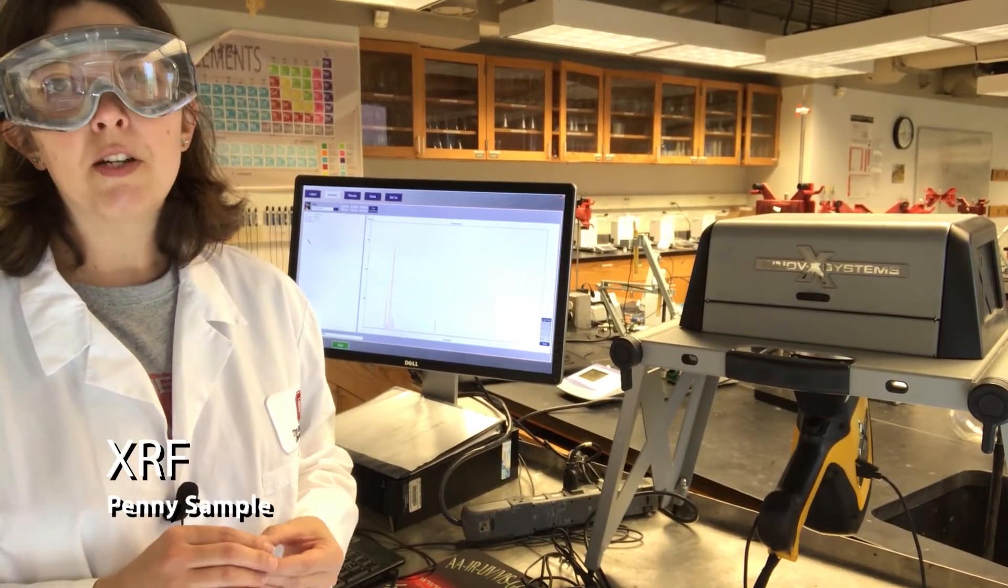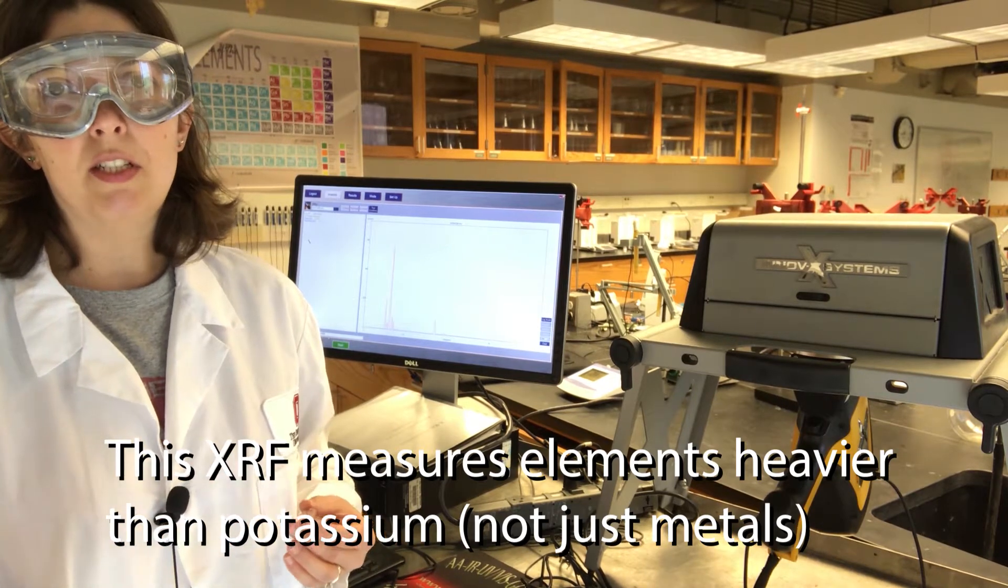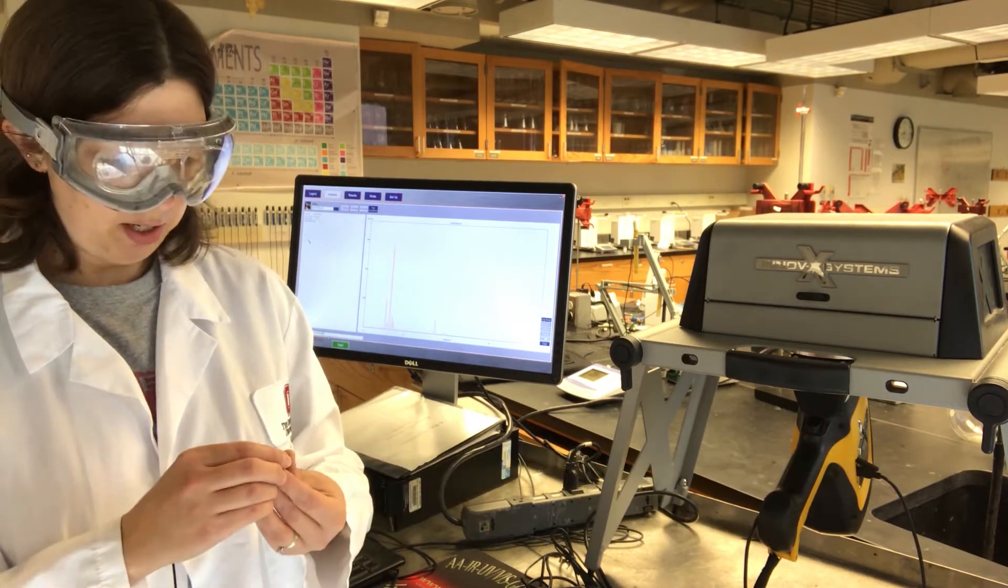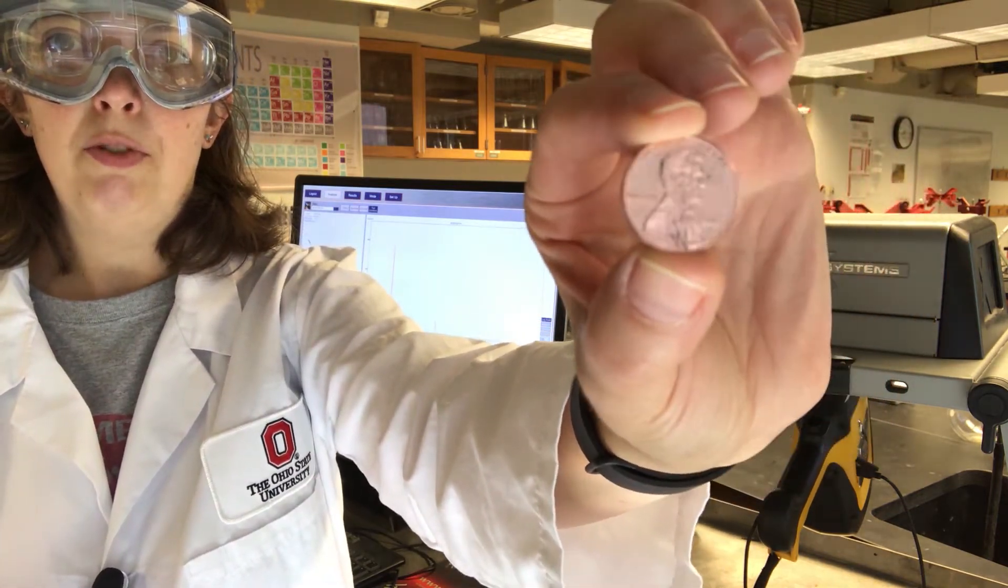X-ray fluorescence measures the metals that are present at or near the surface of a given object. We're going to show you that today. I have a penny from 2005.